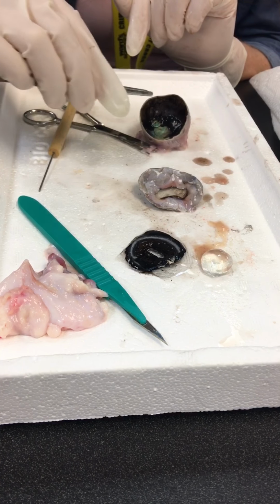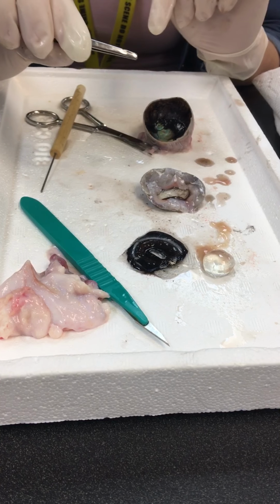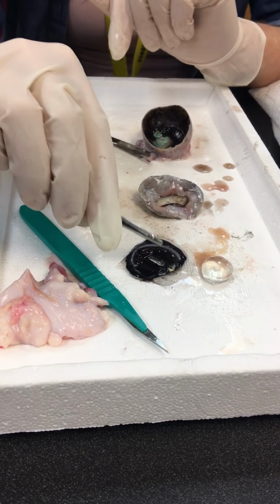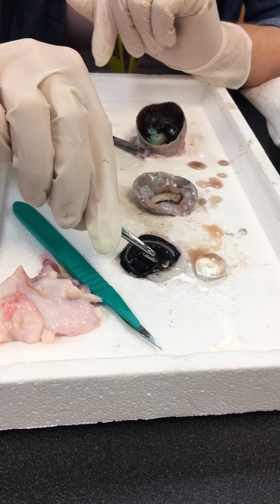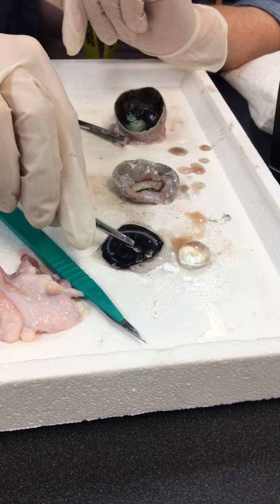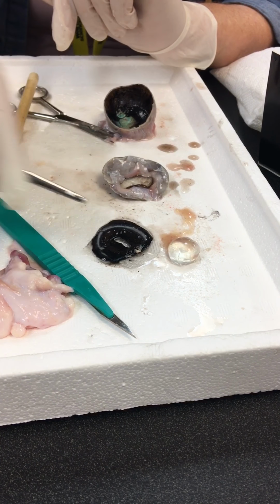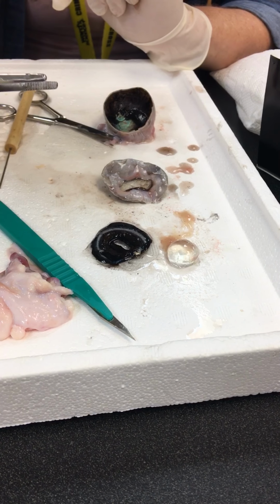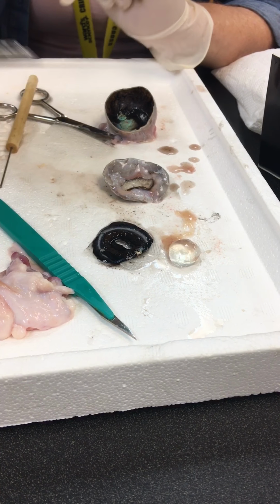All right. Did we get everything else? Okay. So, definitely this is the pupil here in the center. It's just the opening. That's all that is. And then we've got the iris around it. Okay. It's a pretty simple structure.